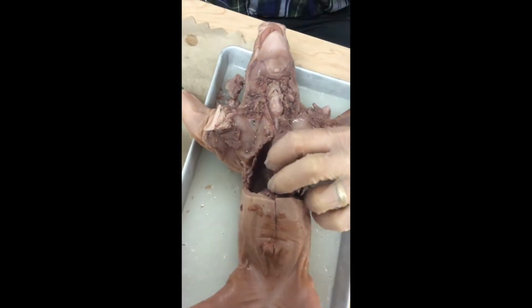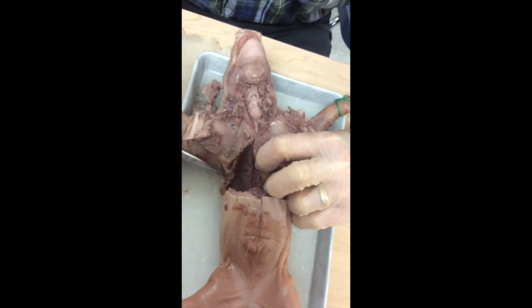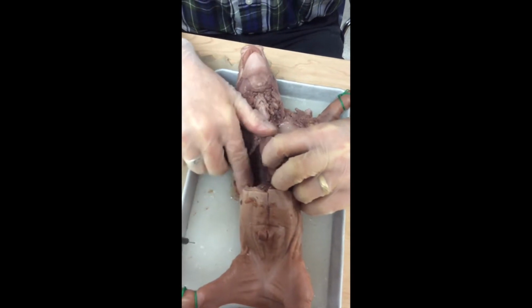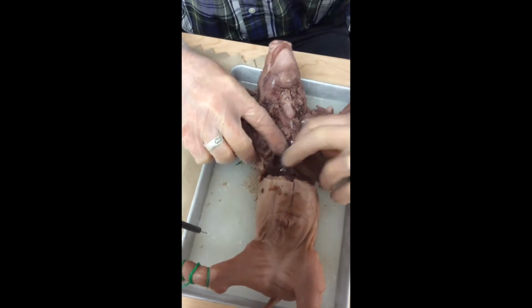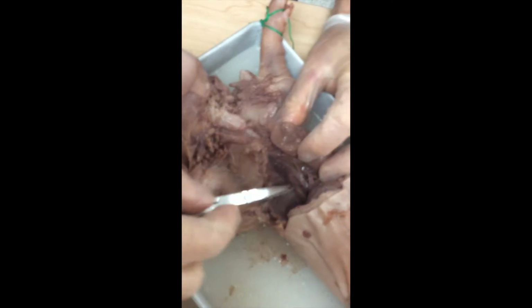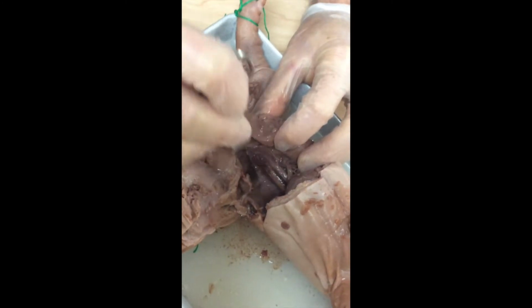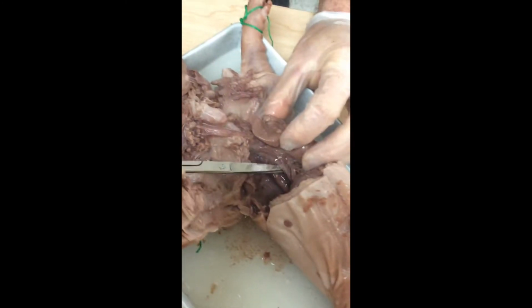I'm going to carry this cut a little lower so the fluid will drain out of there better. Draining that out of there. As I get my fingers back underneath there, I discover that we've got some pipes underneath. Okay, so I've removed all the ribs here, and I have some ribs still, and we've got the backbone down here. Now you see there's a pipe right here.